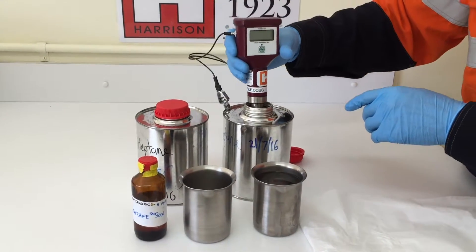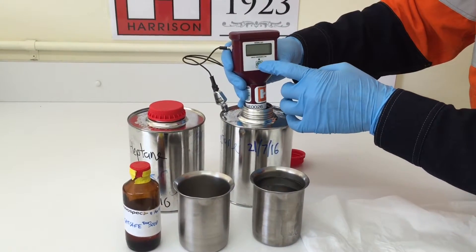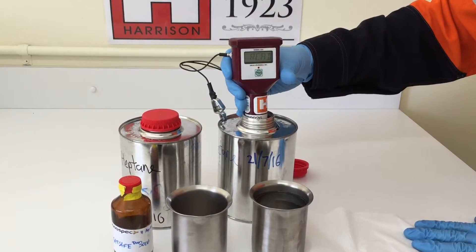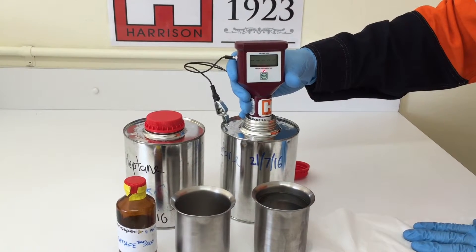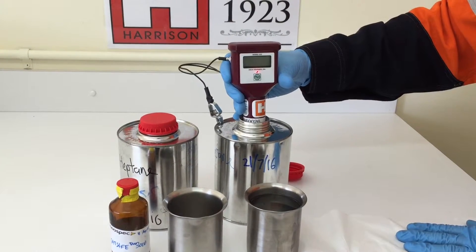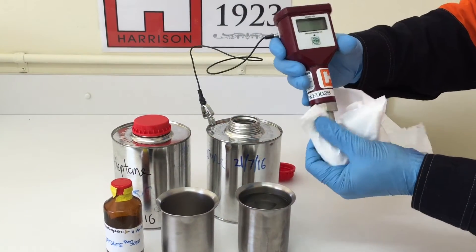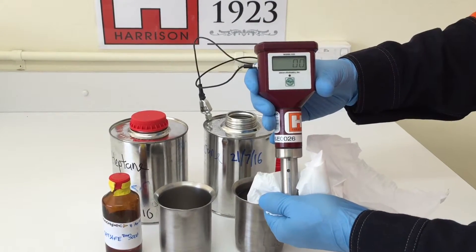Insert the probe into the sample and make sure the probe is covered up to the holes. Press the button once, then press it again and it's reading the sample. Once again the conductivity should be zero.